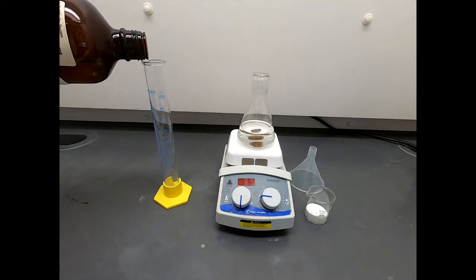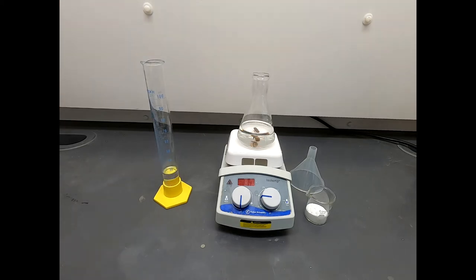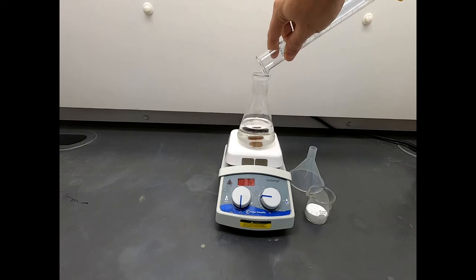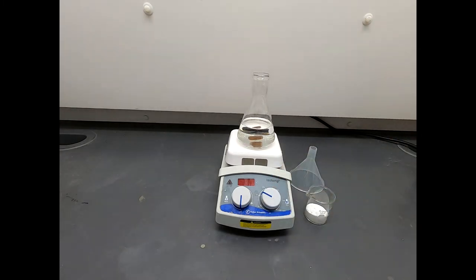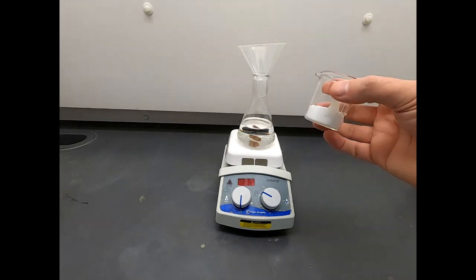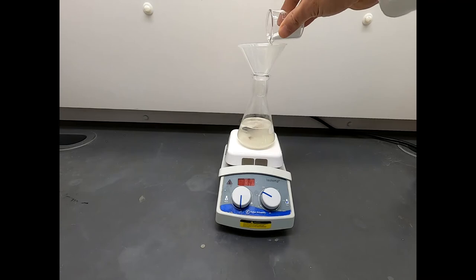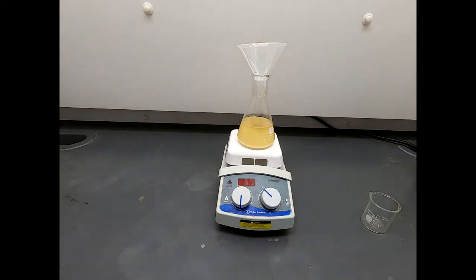Maybe not perfect, but certainly good enough. Now we need to add in another solvent. I'm going to add in a little bit of water. Tell you what, let's add the azide first. Show you why we do this. So this azide, this is a pretty good amount of powder. I don't want to try to freehand dump it into the Erlenmeyer flask. Maybe I can do that, maybe I can't, but it's much easier if we just use a funnel. Now I did take some time to make sure that some of the chunks were broken up. So there are some big lumps that came out of the sodium azide bottle, and I made sure that those were powdered.